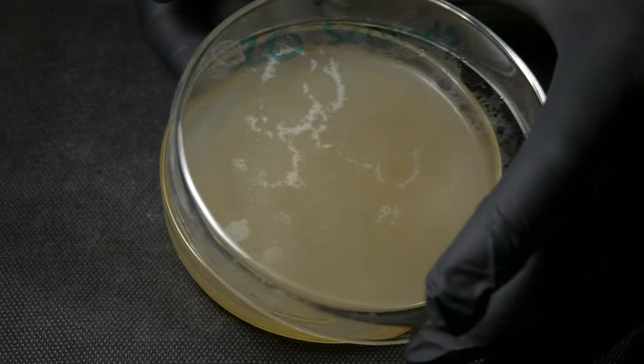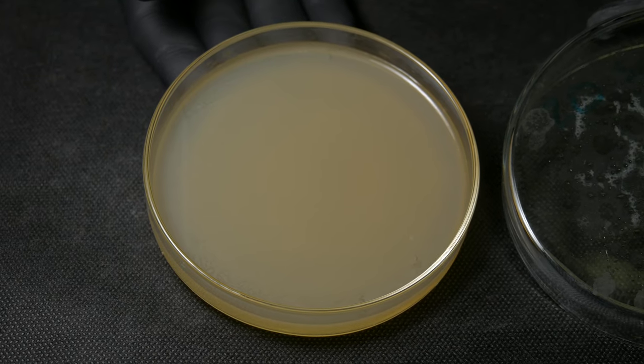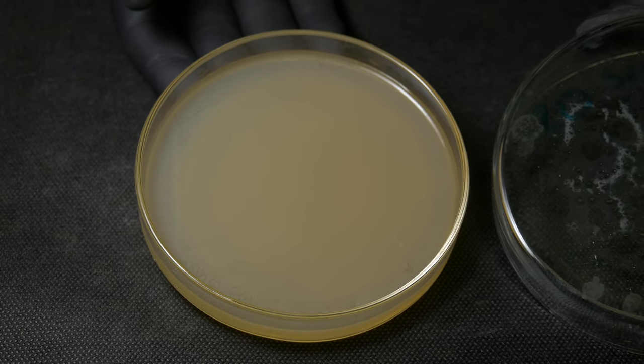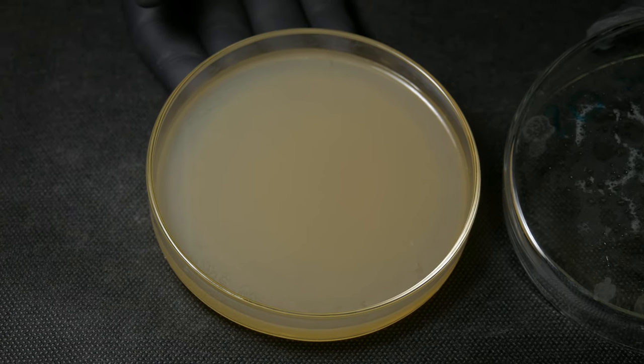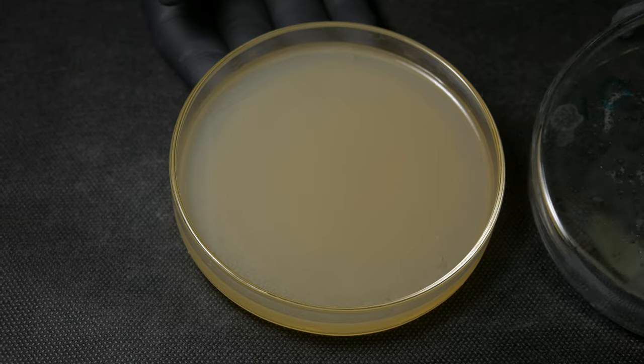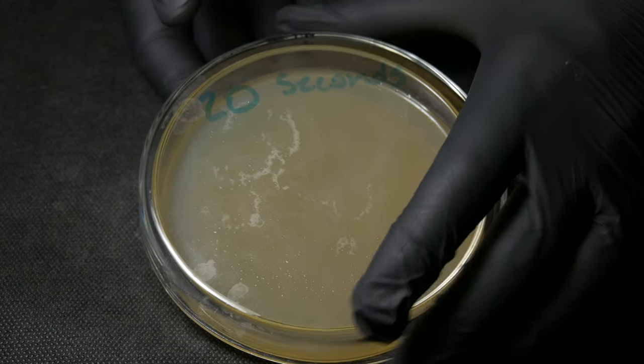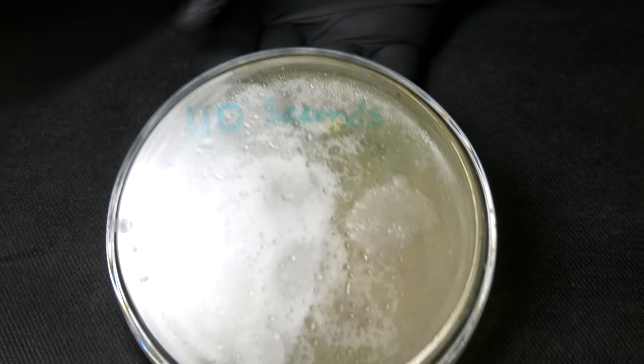Here's the plate after 20 seconds of boiling in the water. It's very difficult to see here, but if you look towards the bottom left of the plate you can see individual colonies. But this is actually an entire film growing across the plate.